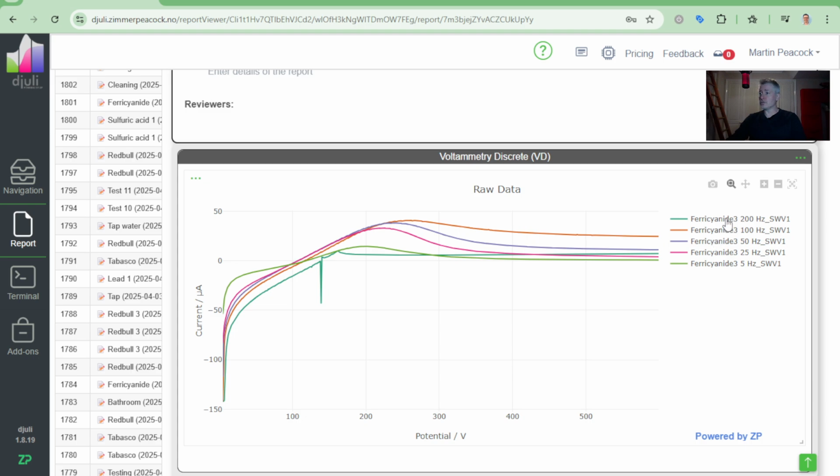If we turn off the 200 hertz, you can see what's going on here, that at 5 hertz, there's a certain, we did get the peak. At 25 hertz, we did get the peak. But you can start to see that this non-specific part of the signal, so the sort of signal is really here, but this becomes increasing with the frequency. Now at 200 hertz, I think the whole thing is just going so fast, it's just kind of falling down, let's say. So I turned that one off quite quickly.